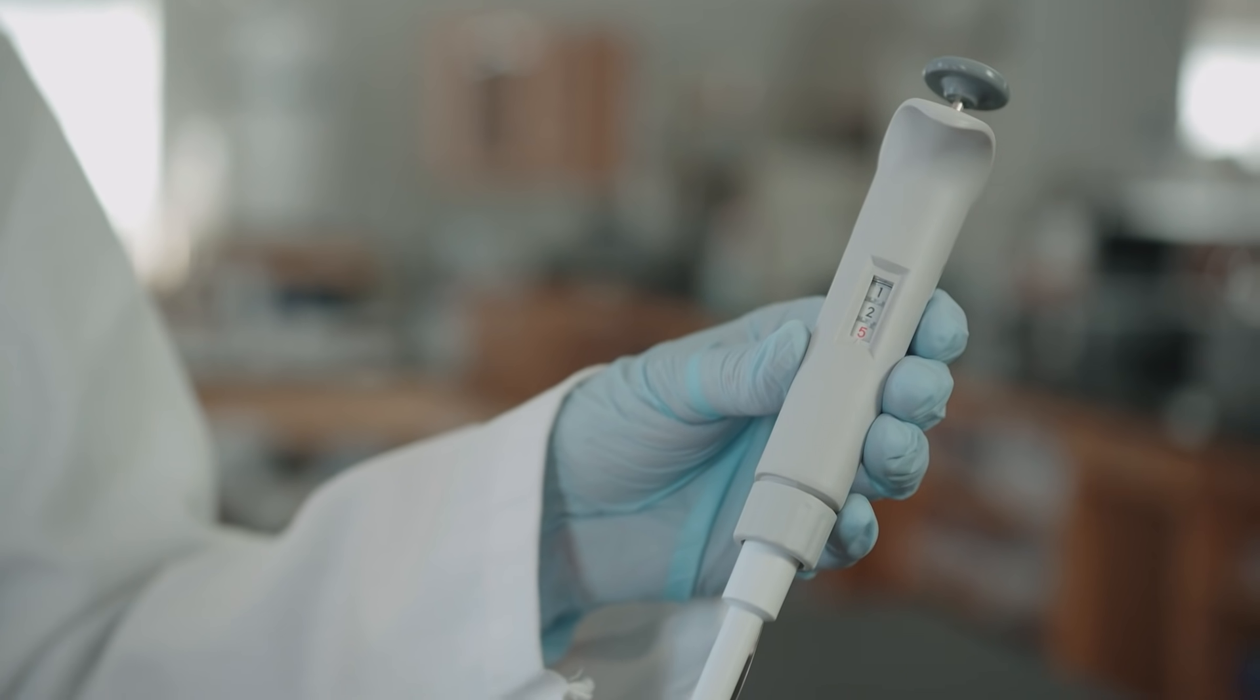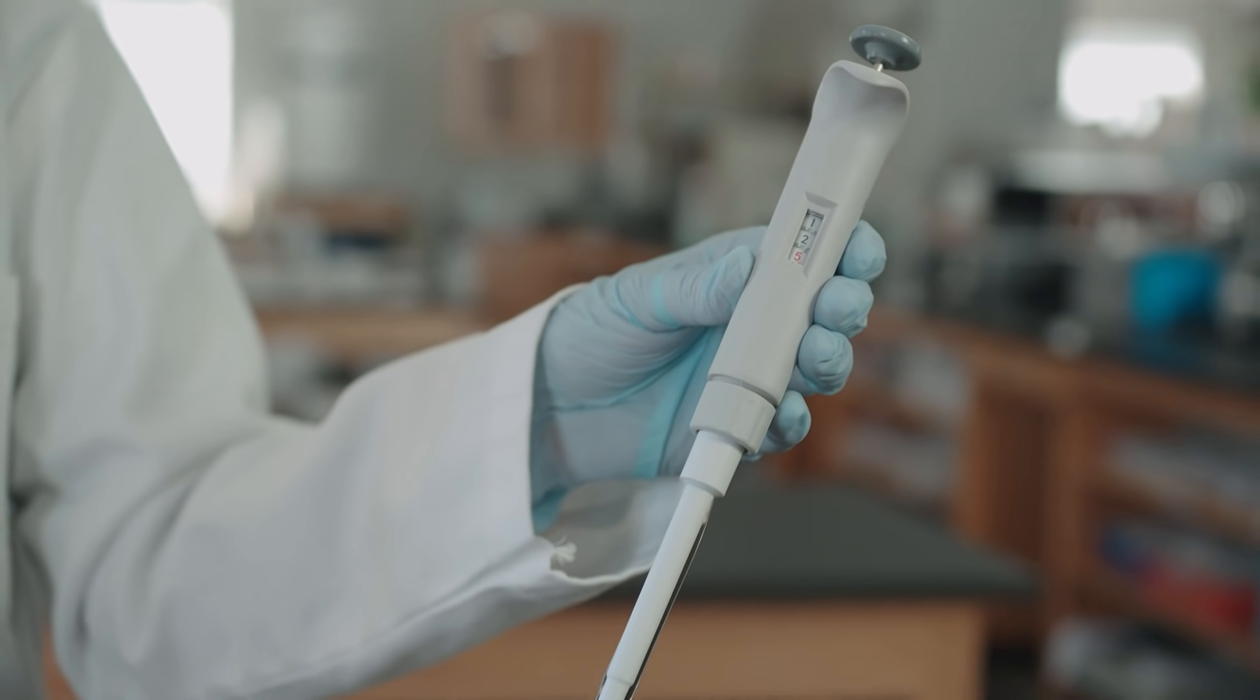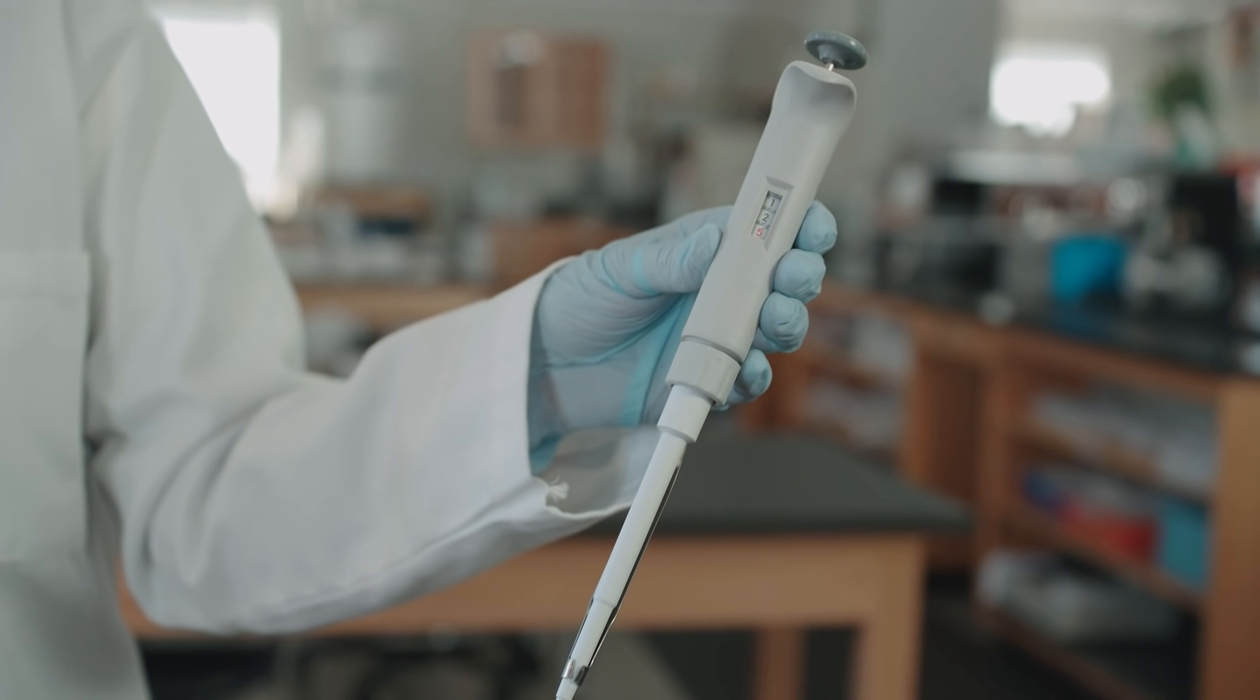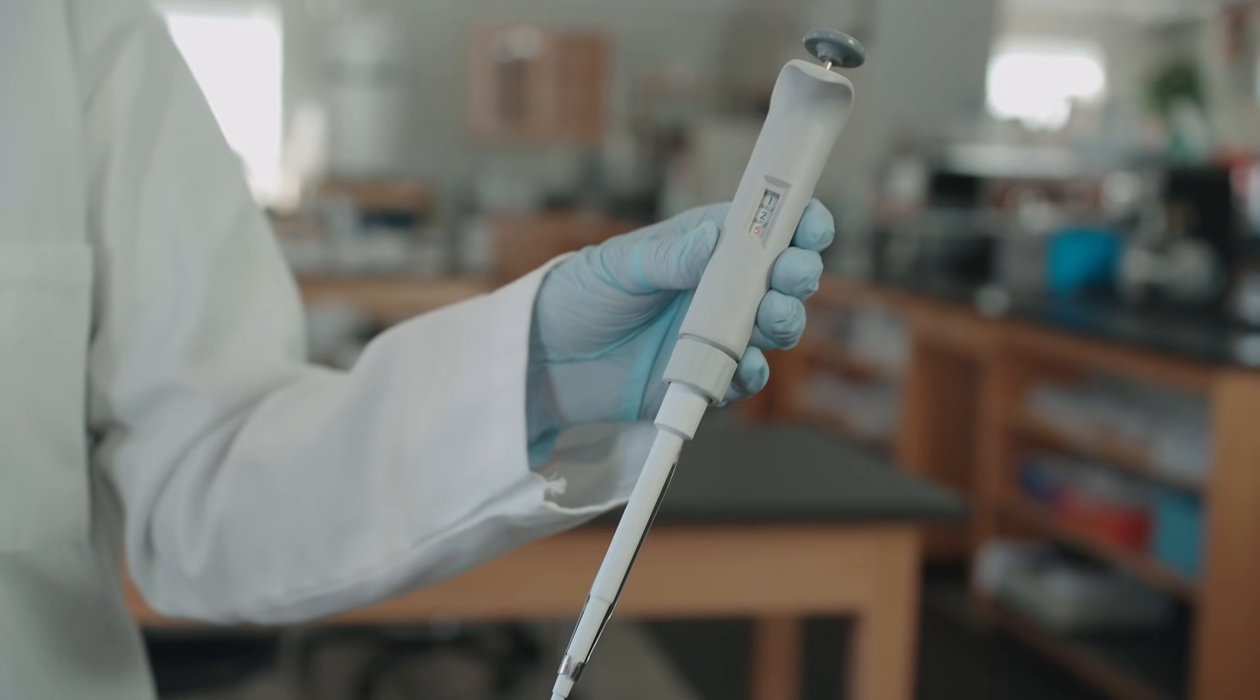We will use the P20 micro pipette to demonstrate how to use a micro pipette. However, the principles learned with respect to this pipette generally apply to other types as well.